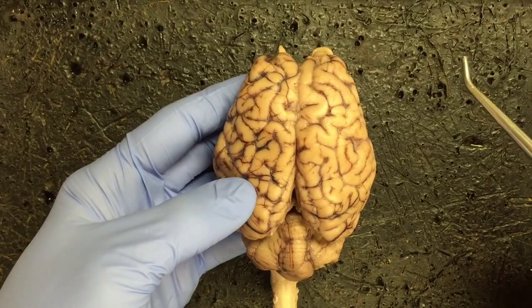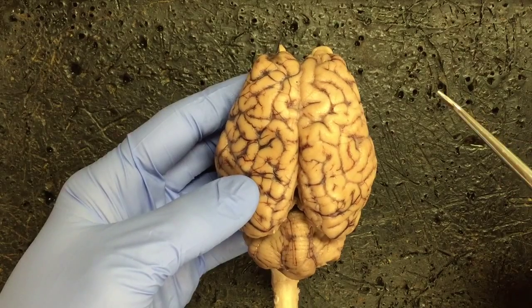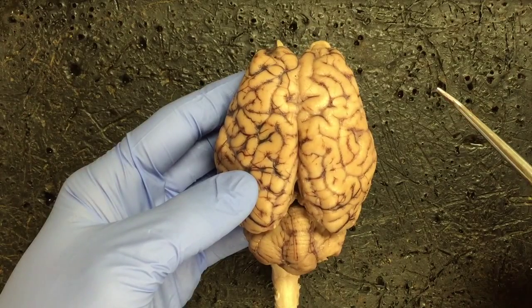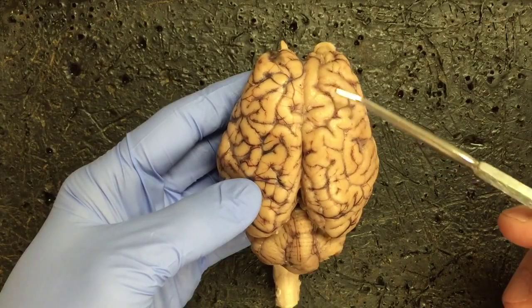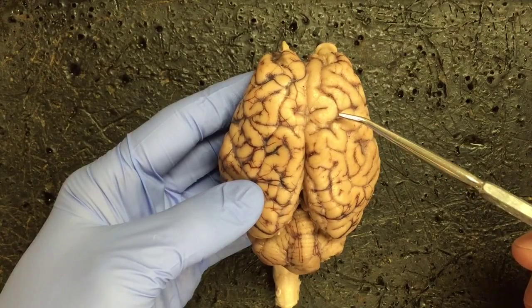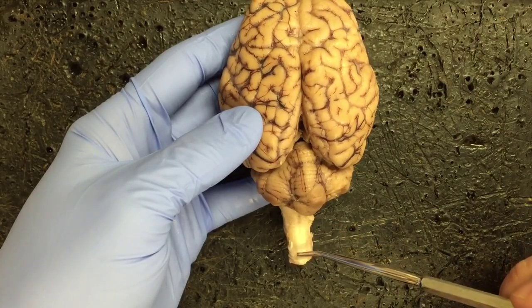The first structure, the corpus callosum, I'm actually going to wait to discuss until we look at the internal structure view. Similarly, the dura mater is something that we can't see. It's been removed as part of the preparation for our dissection. The one that we can see, though, is the pia mater. It actually is what makes the surface of the brain shiny. It's that thin membranous layer that hugs the surface of the brain. Going to the posterior part, we can see the spinal cord extending just beyond the cerebellum.